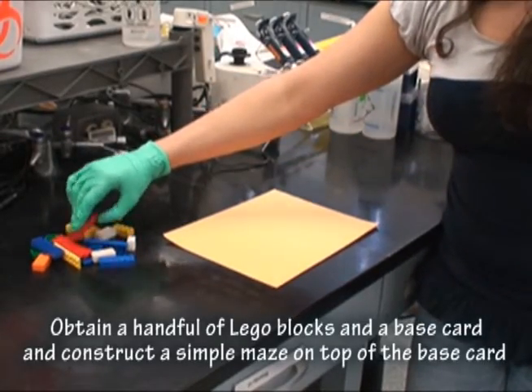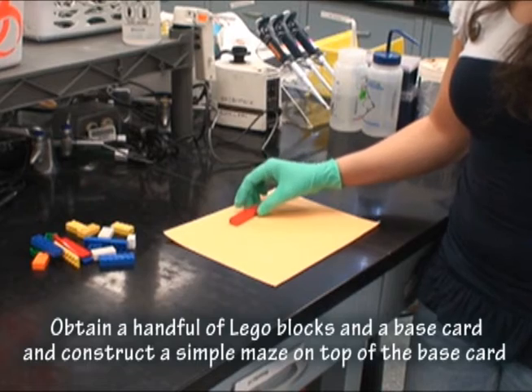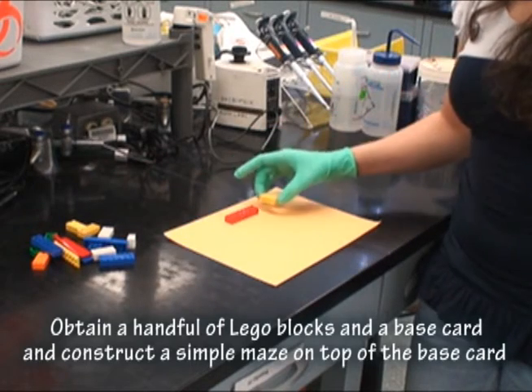Obtain a handful of Lego blocks and a base card, and construct a simple maze on top of the base card.